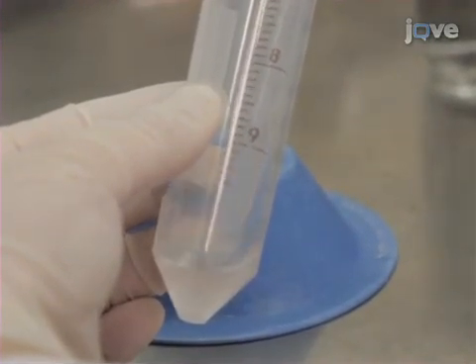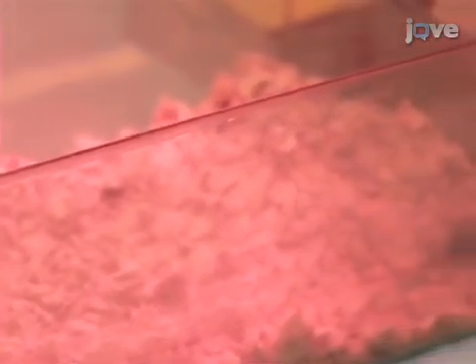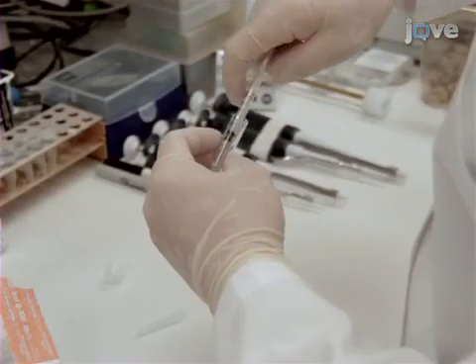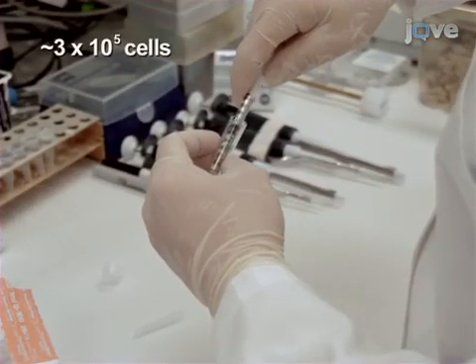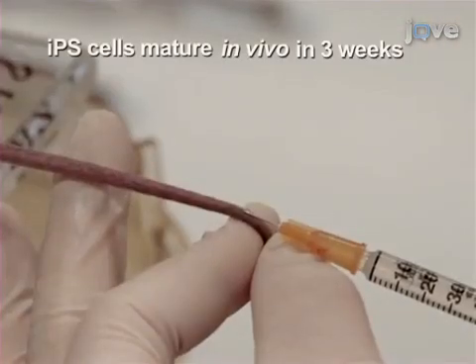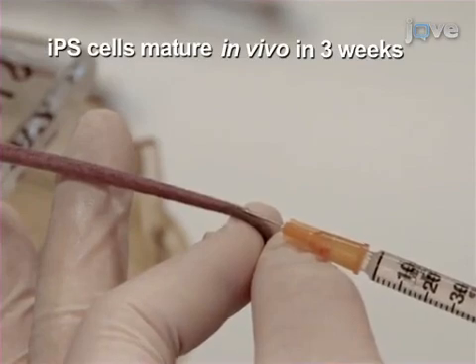Before IV injection, place a 4-week-old RAG-deficient mouse under an infrared light to dilate the tail vein. Then fill a 1 milliliter syringe equipped with a 26.5 gauge needle with 200 microliters of the cell suspension and adoptively transfer the cells through the dilated tail vein.